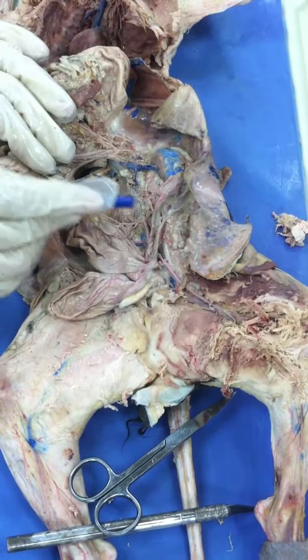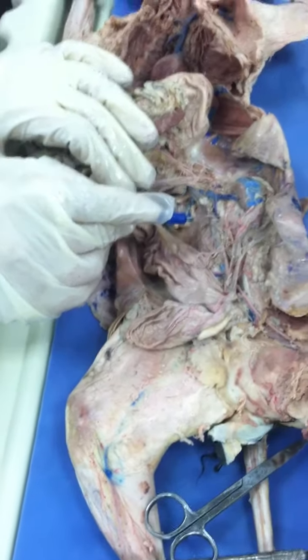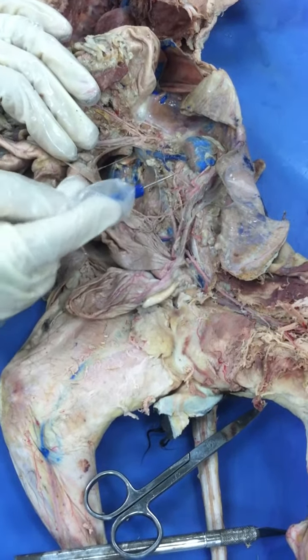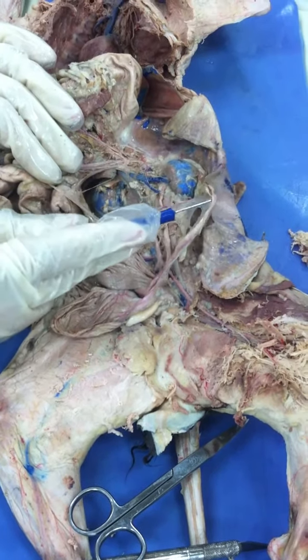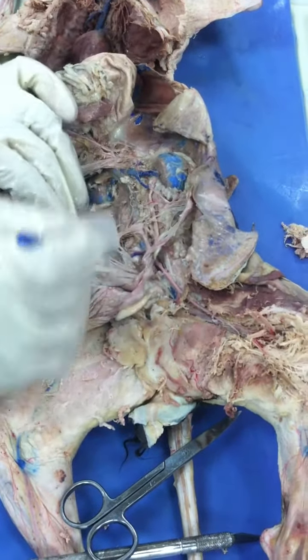Now here we're going to see an anatomical differentiation. That gonadal, because it's a female, we call it ovarian. But this is the remnants of it. But we see that it's going towards the gonads, right? Normally it would go all the way to the ovaries. If it's a female, we call it ovarian. If it's a male, we call it spermatic. Very good. So we're going to continue.